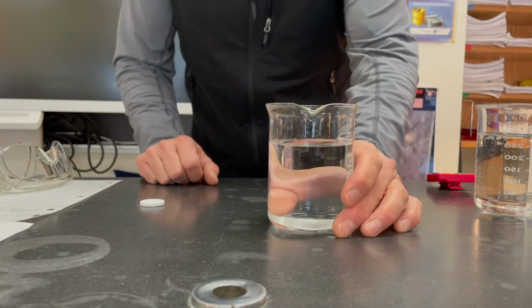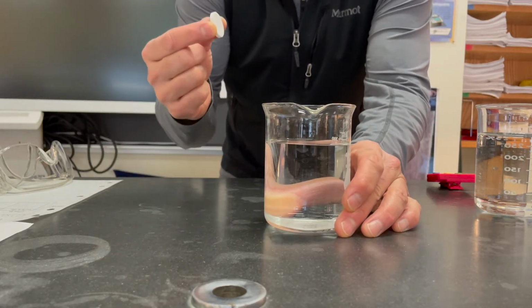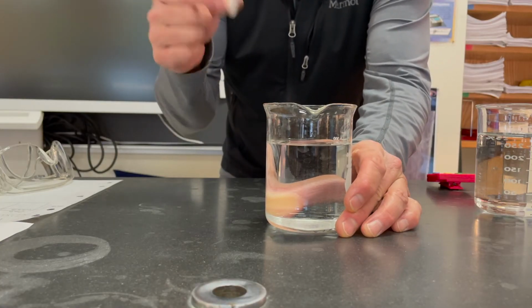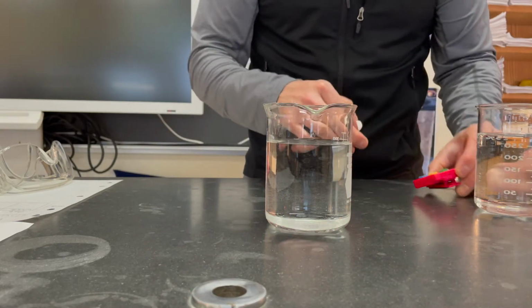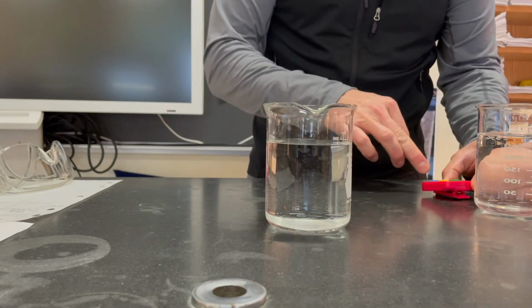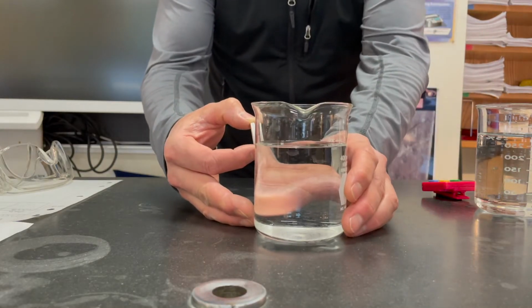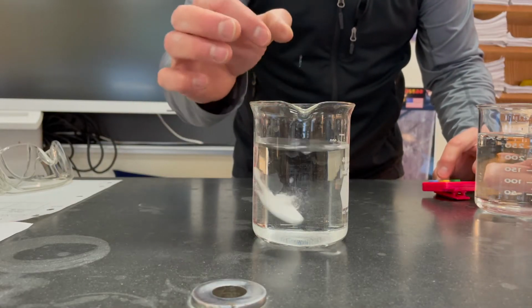All right, so let's do this. It's a short lab. I am going to place it in, so take your cell phone or a timer at home or a watch or whatever you have. I want you to time it, and I want you to record your own time. I'm going to record my own time here too, so I have an answer key, but I want you to do this on your own, and then we'll check it. All right, on your mark, get set, and go.